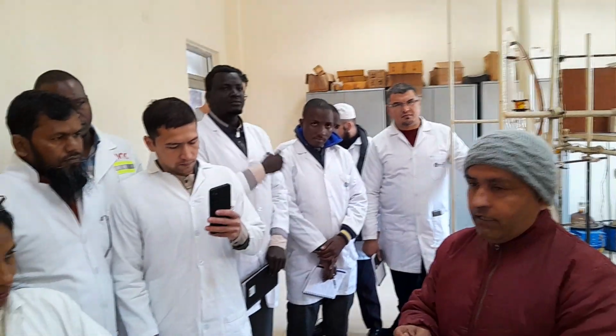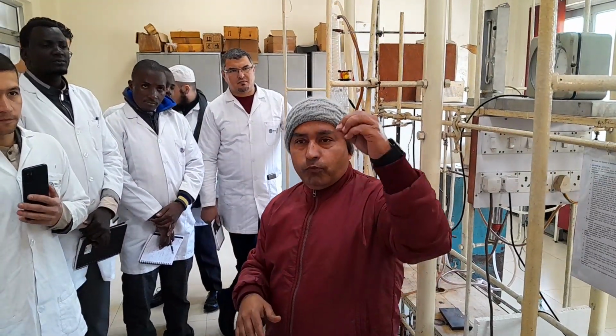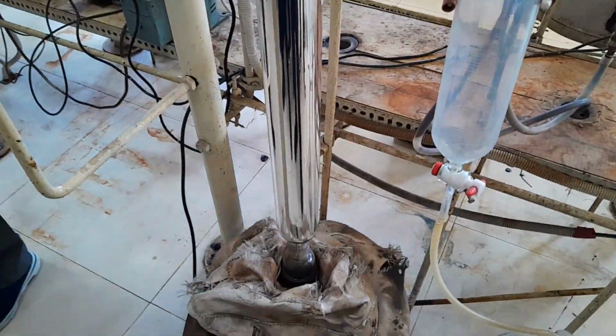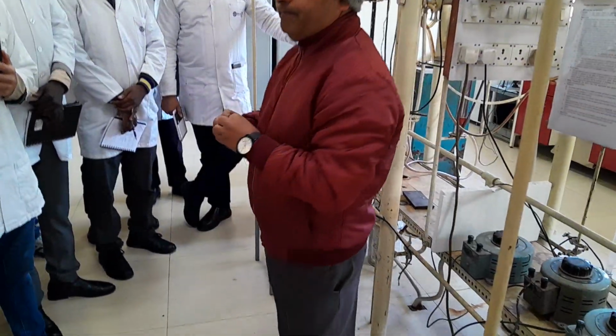Transportation is taking place, and the downstream is where crude oil is processed. Okay, so crude oil first comes to us. Then what is the very first property which is very necessary before going through the distillation process? So first we will check the water content of the crude oil.